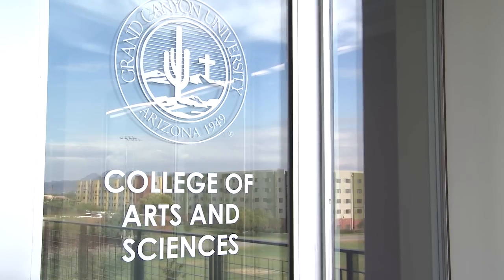Hello everyone, my name is Melissa and I'm here at Grand Canyon University in the College of Arts and Sciences brand new DNA analysis lab. I'm here today to give you a quick short lesson on bloodstain pattern analysis. If you come to GCU and you major in forensic science, these experiments are some that you will actually be able to do while you are pursuing your degree.